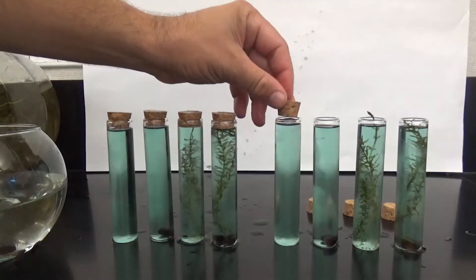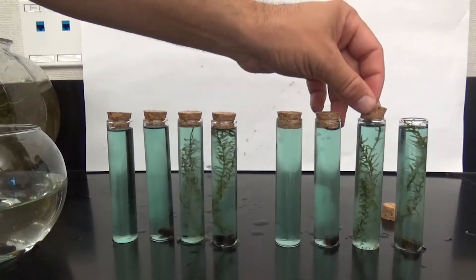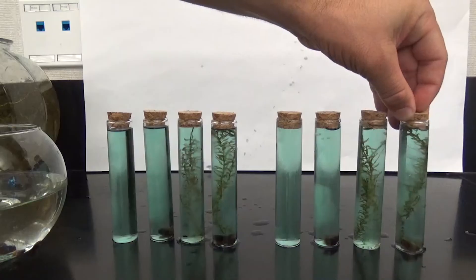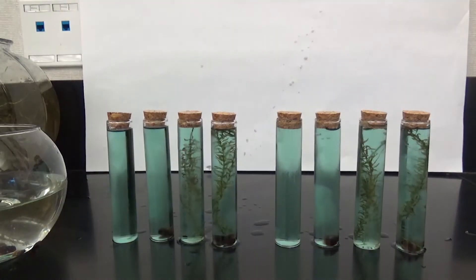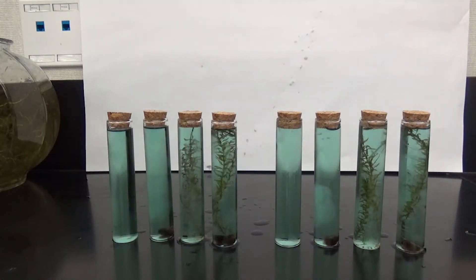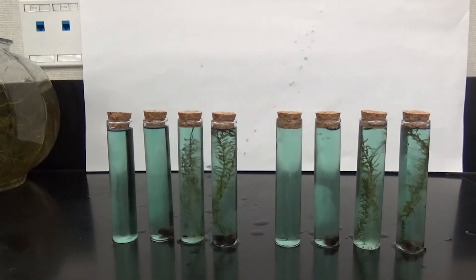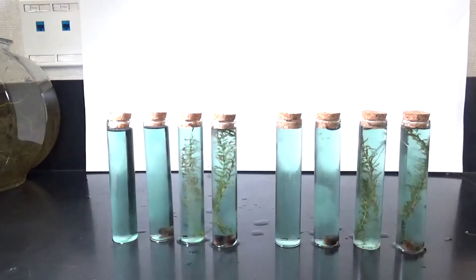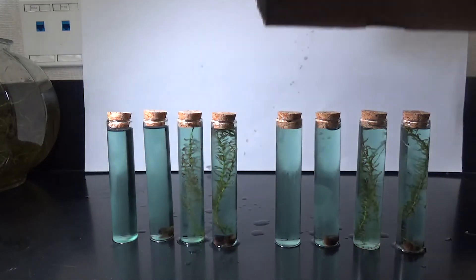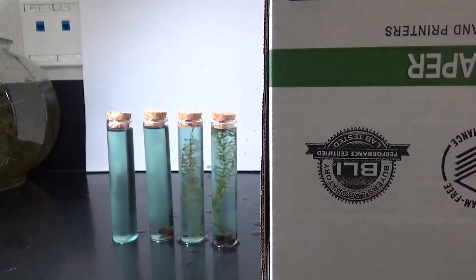After all eight test tubes are sealed shut, you're going to put half the test tubes under the light and half the test tubes in the dark. This shows that some of the plants are undergoing photosynthesis and some are unable to. The first four test tubes will be placed in the light and the second four will be placed in a box in the dark.